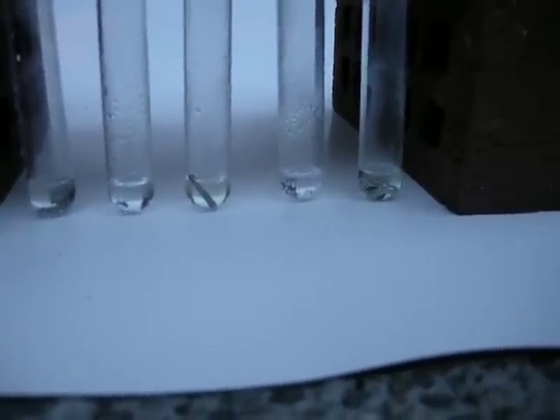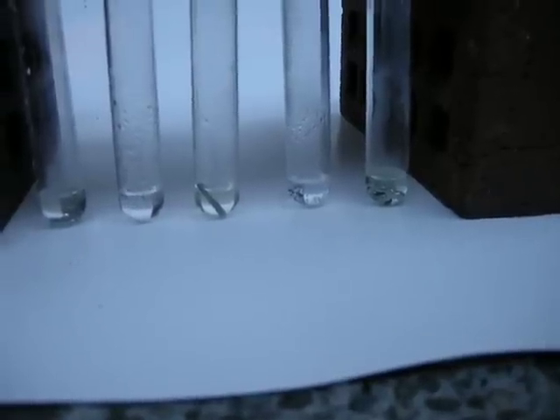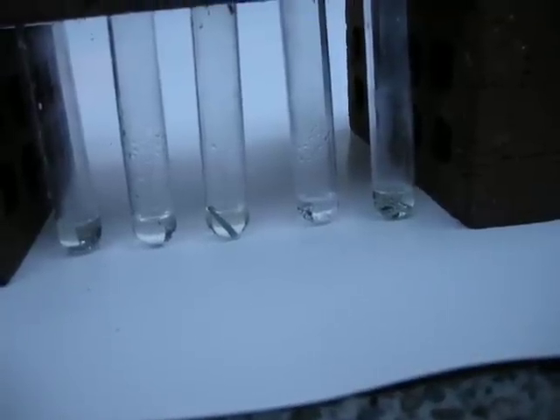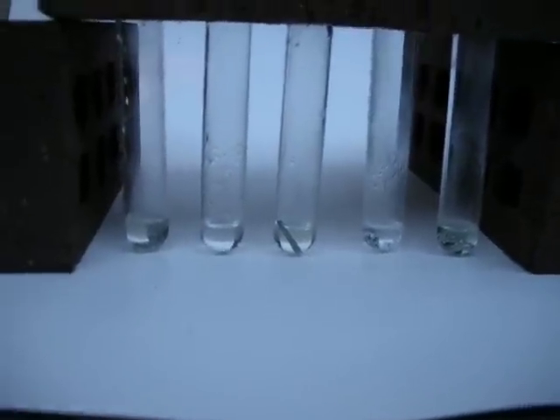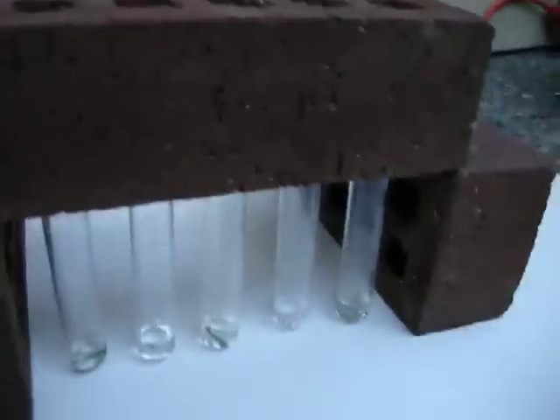The last one still has that faint, sort of cuprous green to it. I'm thinking it still has a little bit of copper somewhere in it. The final part of the project is that when you are done working with acid, you should neutralize it.